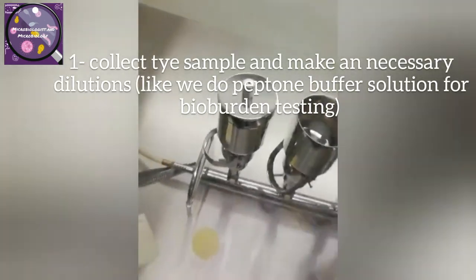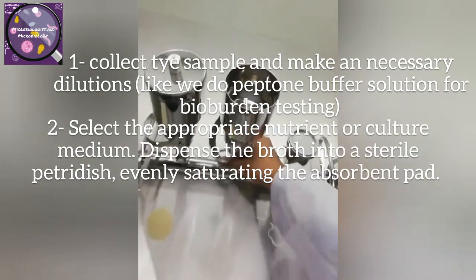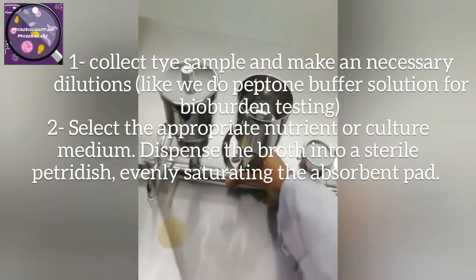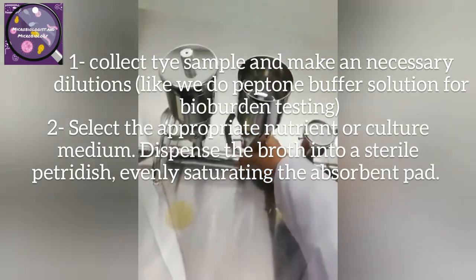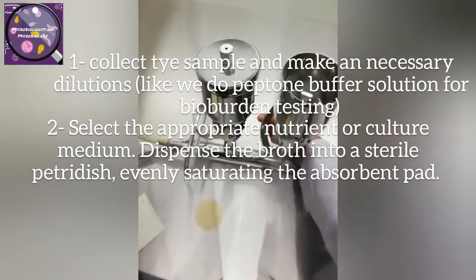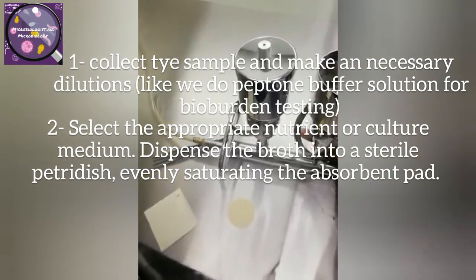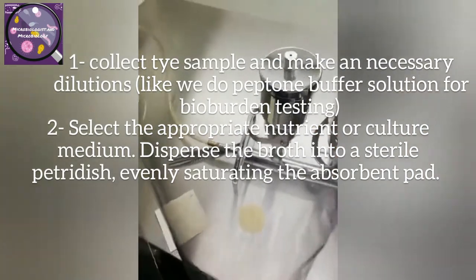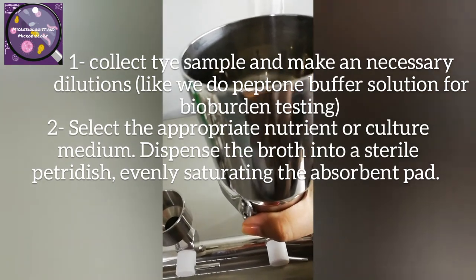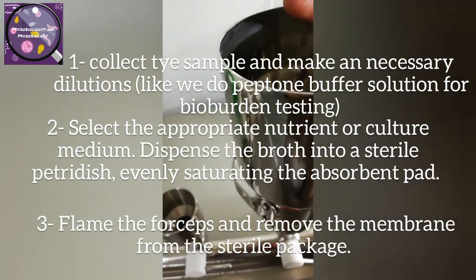For the step-by-step procedure: number one, collect the sample and make a necessary dilution, such as peptone buffer solution for bio burden testing. Number two, select the appropriate nutrient or culture medium, dispense the broth into a sterile petri dish evenly saturating the absorbent pad. Flame the forceps and remove the membrane from the sterile package, then place the membrane filter into the funnel assembly.